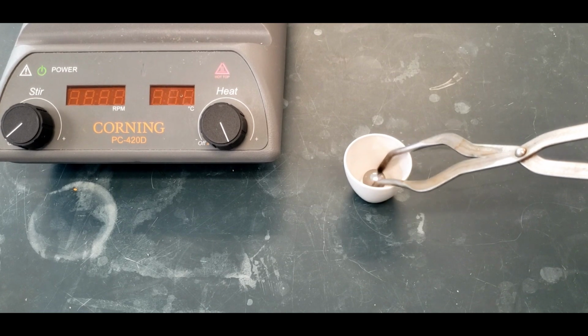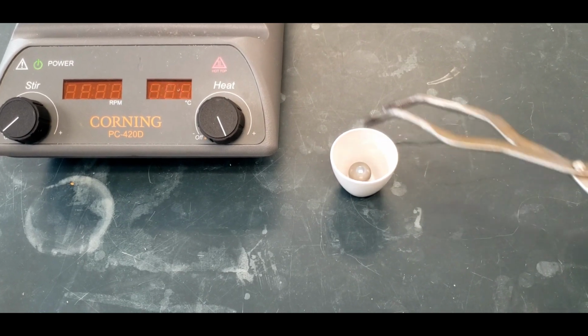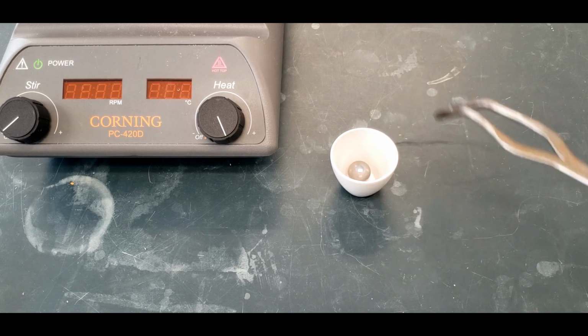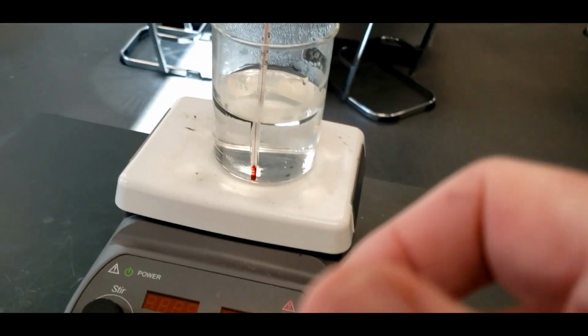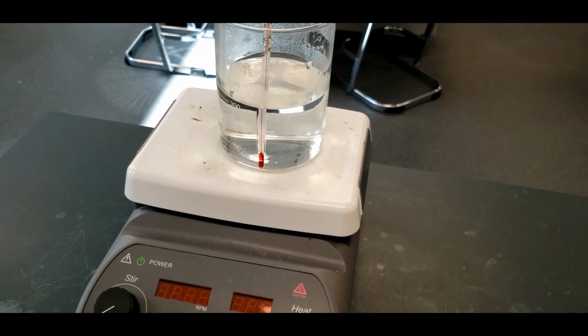All right, so we have a ball bearing that we're going to use. And if you're careful, you can pick it up. Oops. But we don't want to do that right now to put it into the water bath, which is coming up next. We put it into a crucible just for that, so it's easy to move around and take out. If you just put the ball bearing in there and it slips out of your grip, it's going to break the beaker.